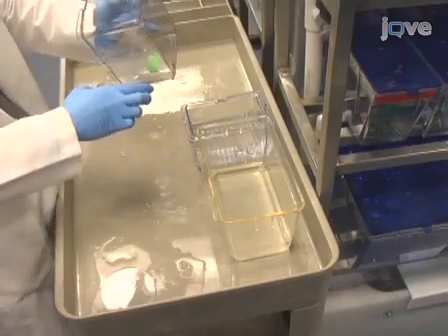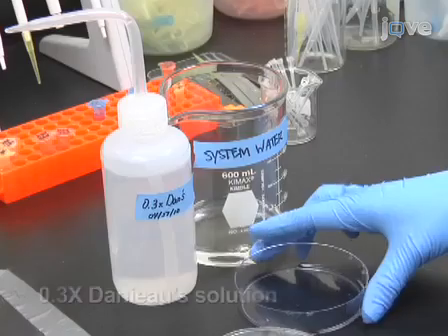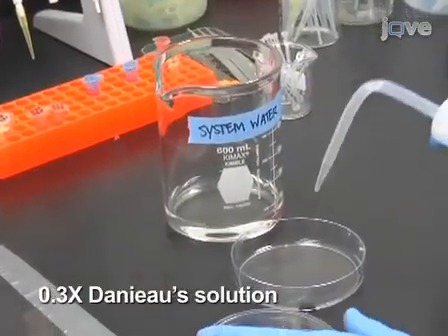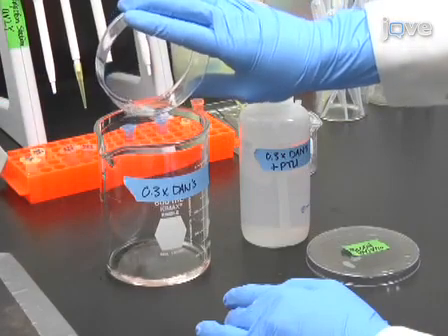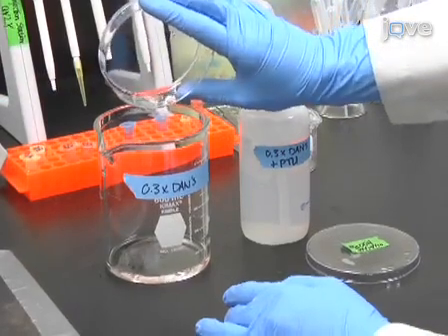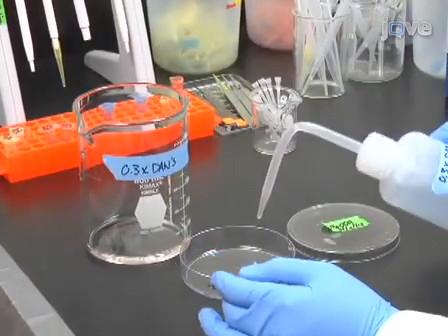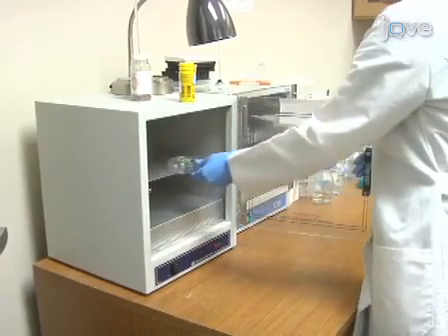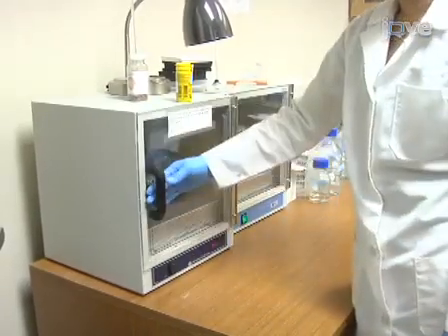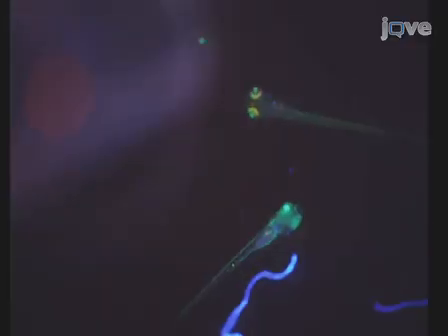Begin by transferring transgenic eggs collected from matings to a petri dish containing 0.3x Danio solution. At 16 hours post-fertilization, add PTU to inhibit tyrosinase activity prior to any evidence of pigmentation in the tissue of interest if the embryo is not albino. Incubate the embryos at 28.5 degrees Celsius. Once reporters are evident, place the petri dish under a fluorescent stereo zoom microscope and sort for desired transgene expression.